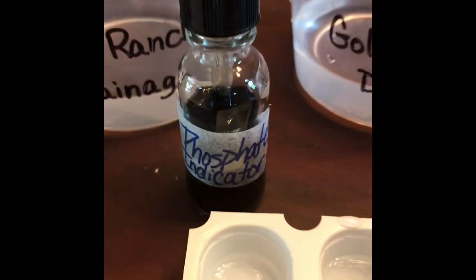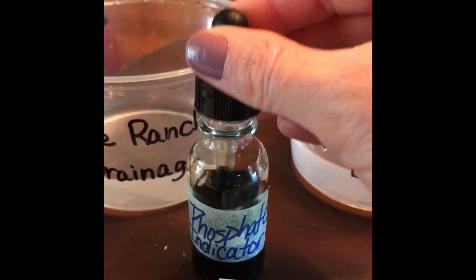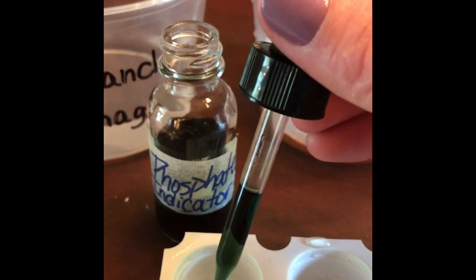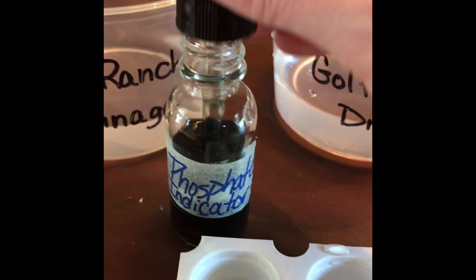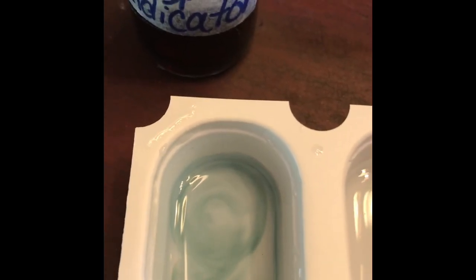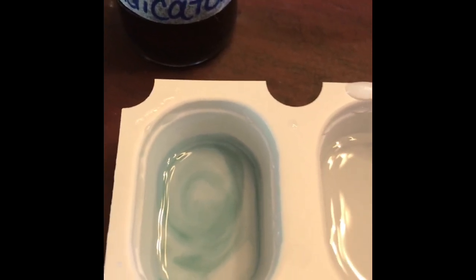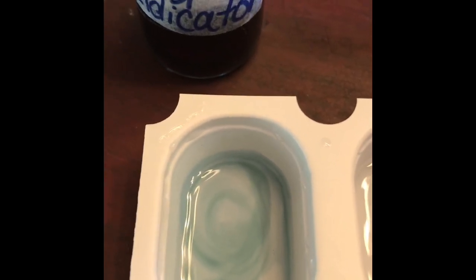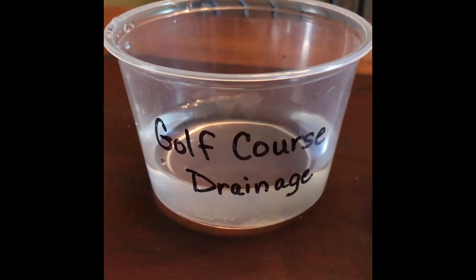So I've already placed a small amount of our water sample in our first little boat. And then with our phosphate indicator, I'm just going to fill my dropper and just add a few drops into the boat of our cattle ranch. About 5 drops. So if you can see there, the color that is swirling, you're going to record that color in your data sheet. Again, yellow is too high phosphate levels for the fish, and blue or green is an okay level of phosphate in that water for the fish.